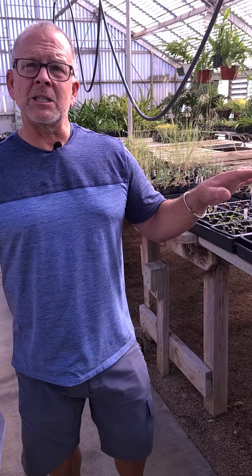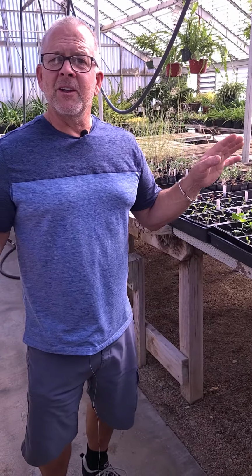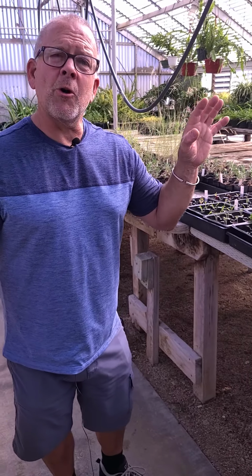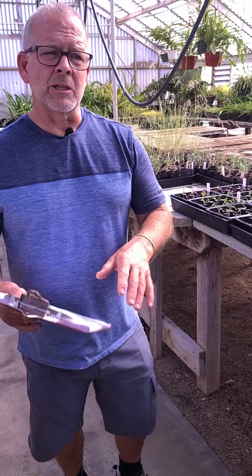But we're going to put these in a water or liquid-based growing solution, which is kind of popular for certain kinds of plants that we won't mention here. Some of you guys, probably a lot of you, know exactly what I'm talking about. But we're going to grow it in a nutrient-rich solution. They're going to get all the nutrients they need from this particular solution that we're going to make up. It's called Hoagland's solution, so it's kind of an ideal mix, all the nutrients plants are going to want.